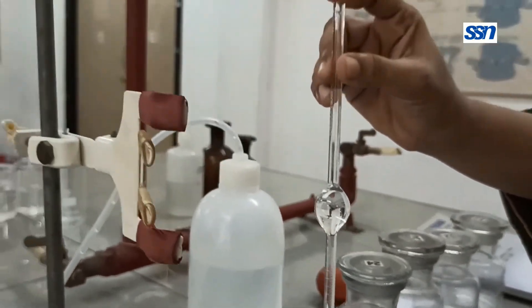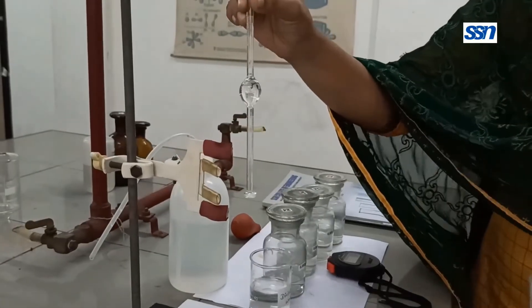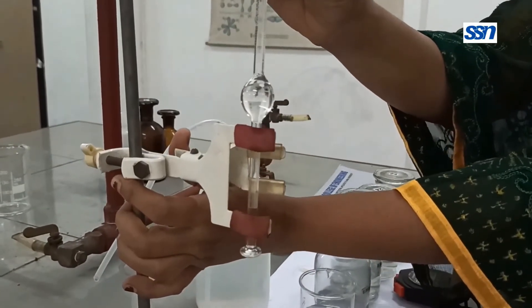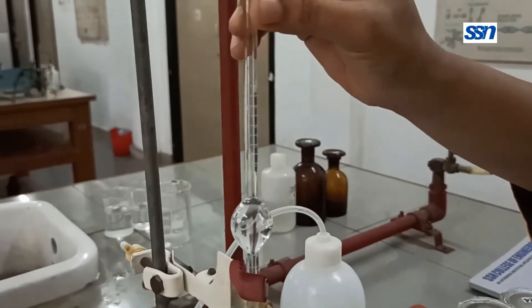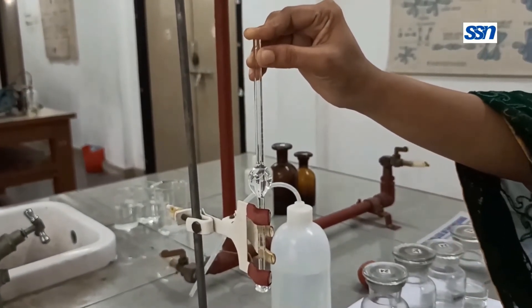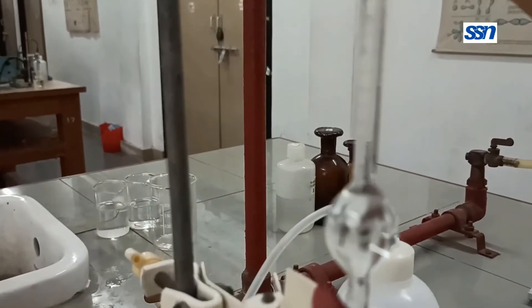Place your index finger on the top of the viscometer and carefully place the viscometer in the stand. Most importantly, you have to ensure that there are no bubbles sticking to the sides of the viscometer as well as in the bulk of the solution inside the viscometer.